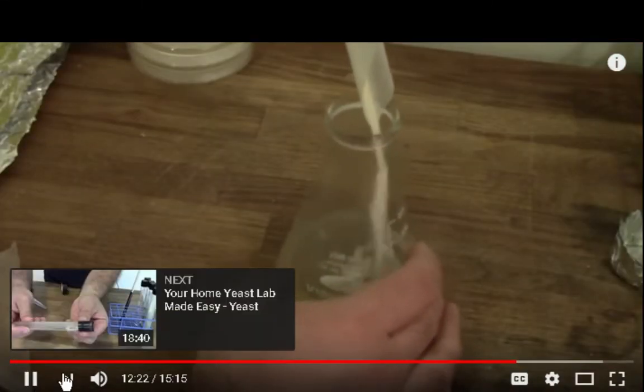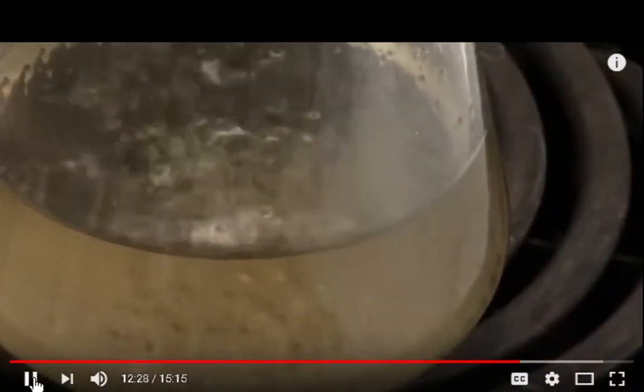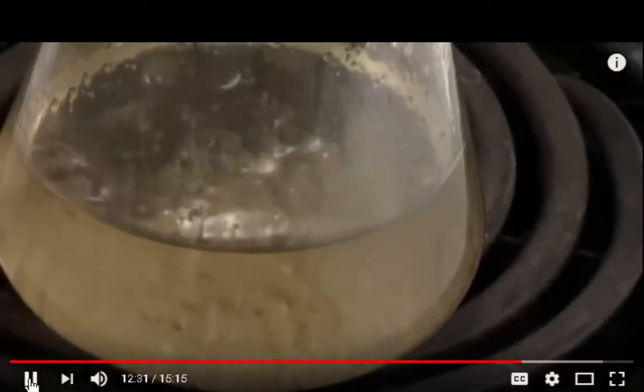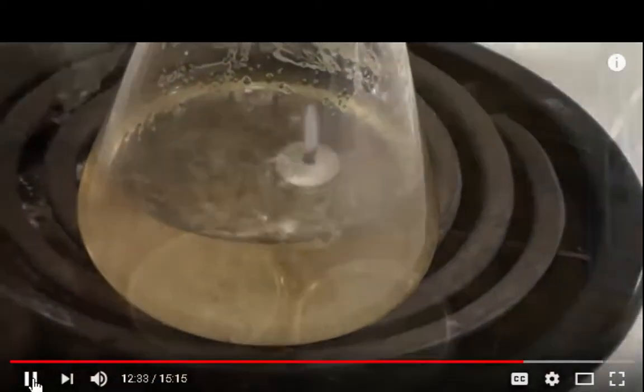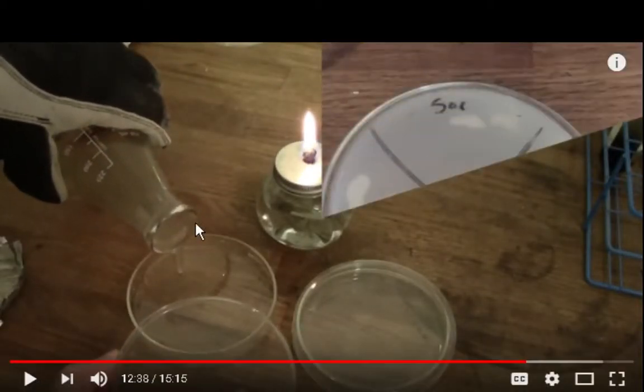And you should be able to blend it in without significant lumps. Once everything is mixed, bring this to a boil for 5 minutes, or sterilize it in your pressure cooker, and then pour the plates just as I showed you with the dry malt agar plates. See, what he does is he takes his flask and runs the lip of the flask over the flame really quickly to sterilize the lip before pouring the fluid, and he's doing it slowly to prevent air bubbles. So that's the other step that was missing in both videos, where the lip was sterilized. So I'll probably do that.